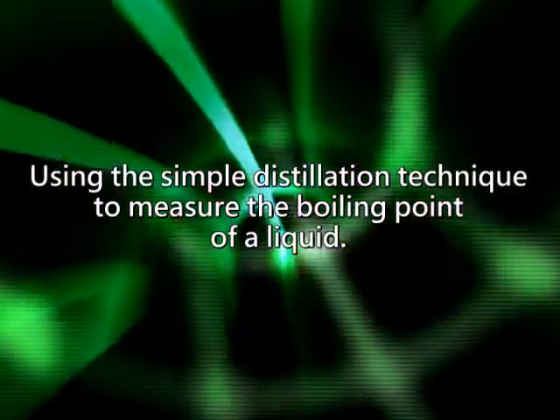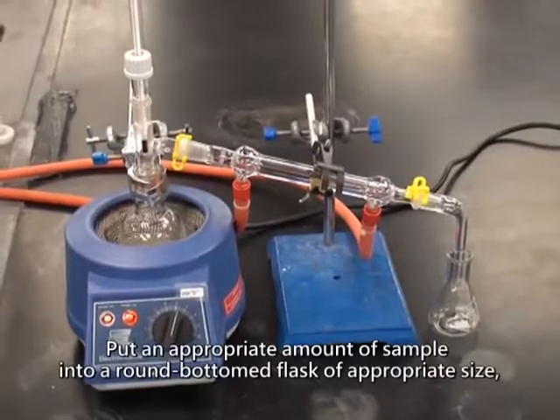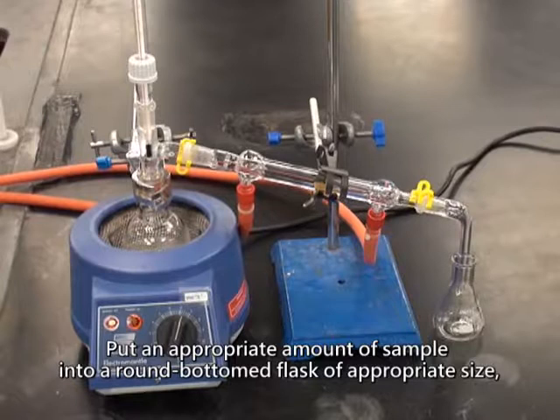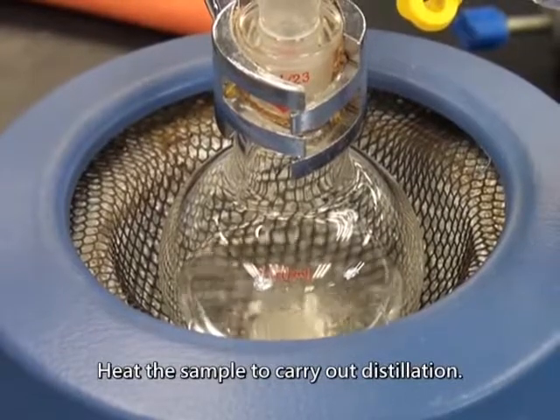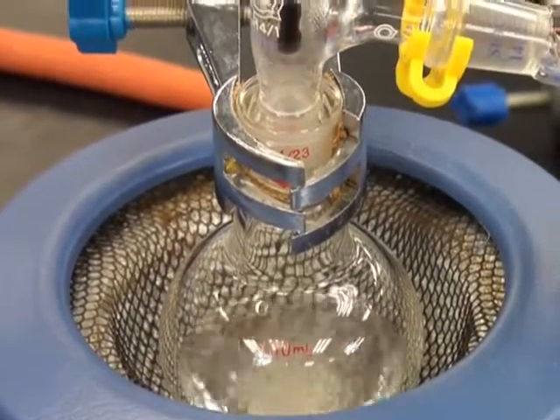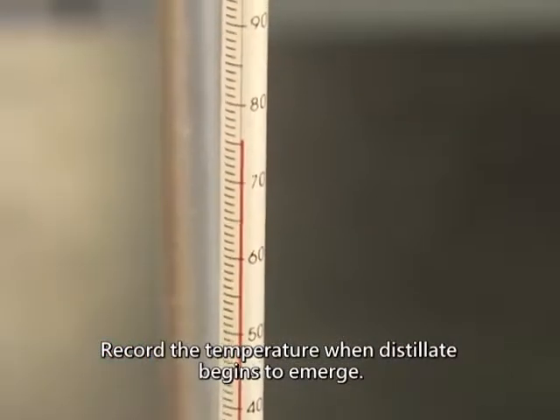To measure the boiling point of a liquid using the simple distillation technique, put an appropriate amount of sample into a round bottom flask of appropriate size, and then set up the apparatus for simple distillation. Heat the sample to carry out distillation. Record the temperature when distillate begins to emerge.